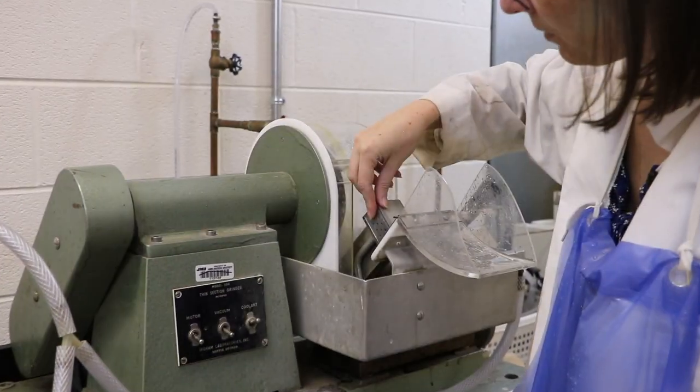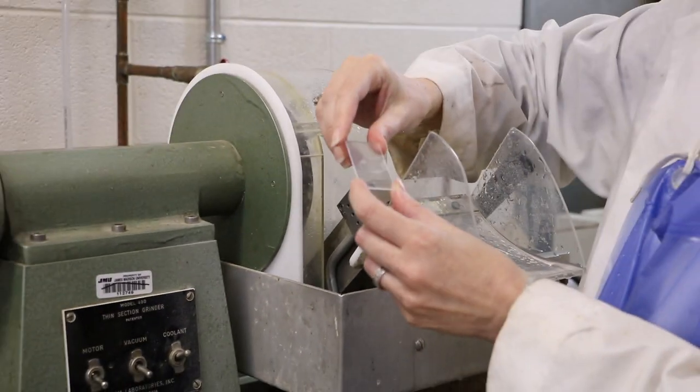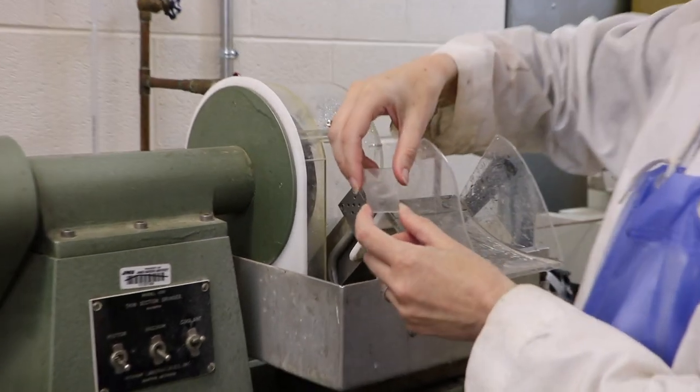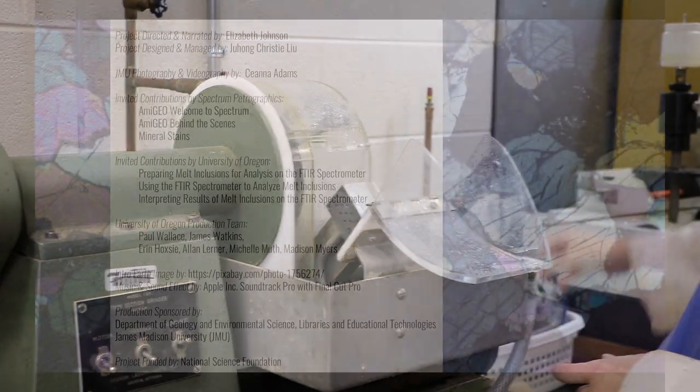So now when the pump is off, I can just pull it off. This one actually worked out pretty well—it didn't crack or anything. To really tell, you just dry off the surface and it'll look frosted like the other ones I showed you.